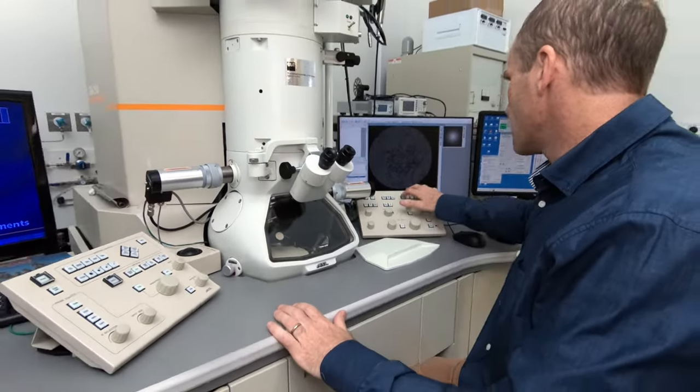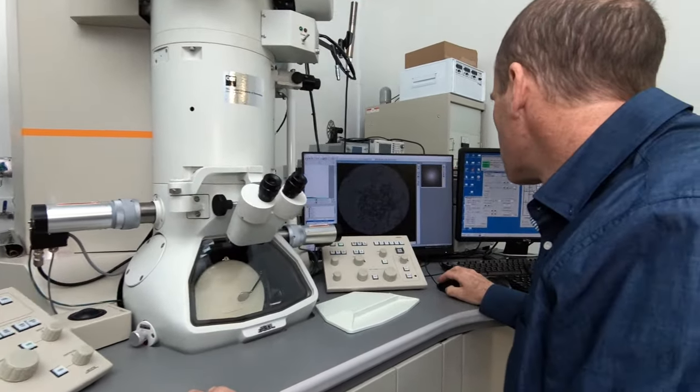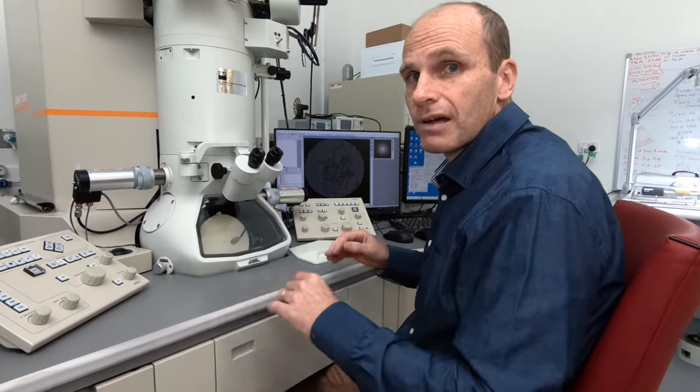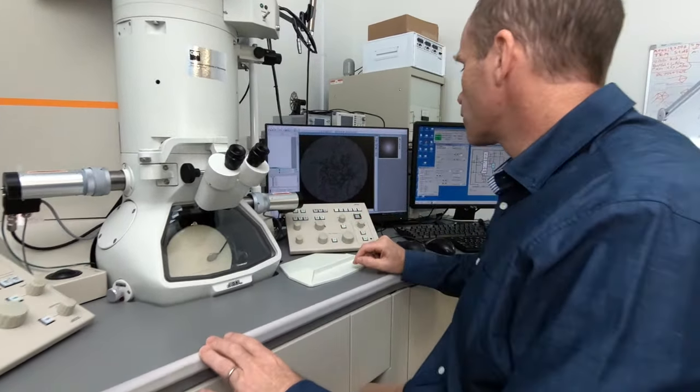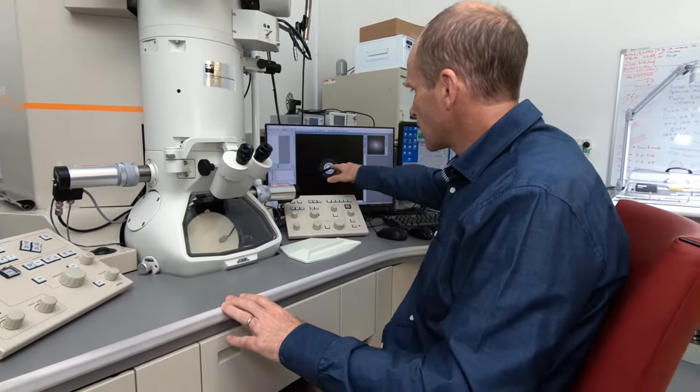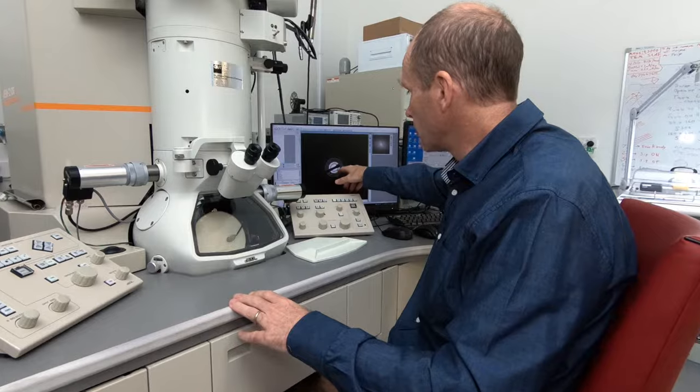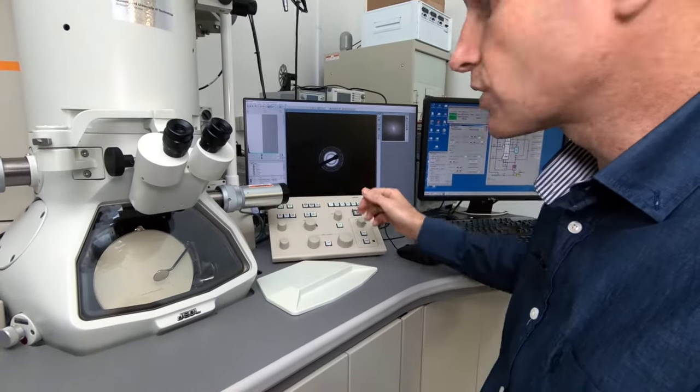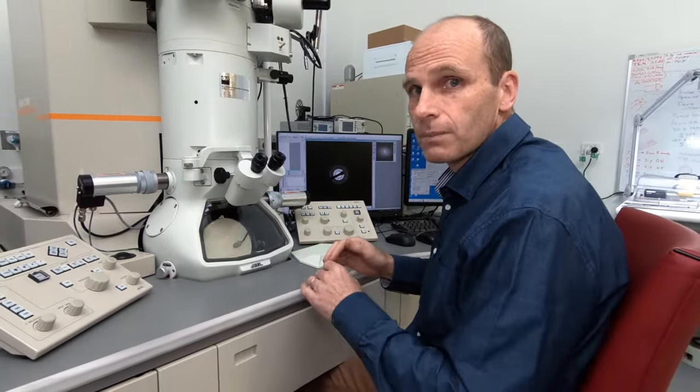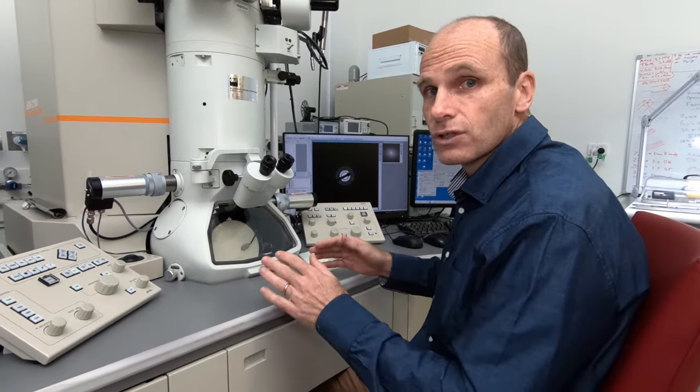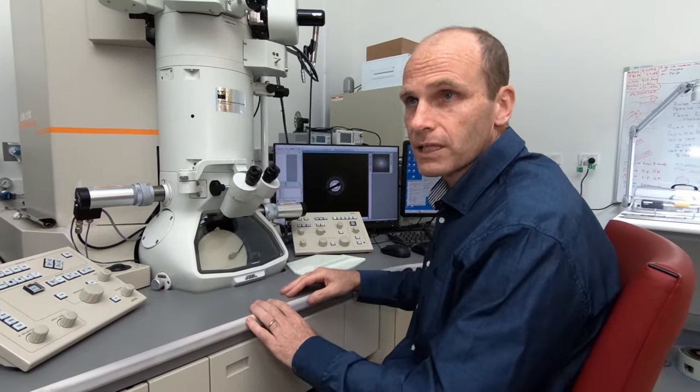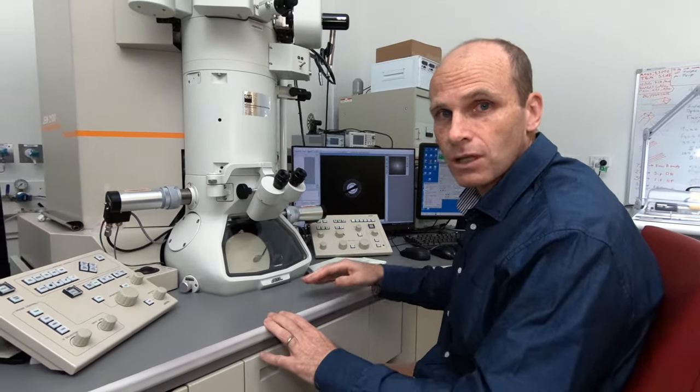And so now if we're going to go and take an image, we'll do that. And for the diffraction patterns, we often take a longer image because there's a large dynamic range that we need to capture. And over here on the screen, we should see that this image gets replaced by a diffraction pattern, which looks like this. So here you can see the central beam. These are for the electrons that have gone through and haven't been scattered by the sample. And then you've got a series of rings. The rings indicate to us that it's a polycrystalline sample. And the spacing of those rings indicates the spacing between the interatomic planes in the particles. And this is very characteristic of a certain crystal structure and a certain type of material. We could measure these and we could clearly identify that the sample that we're looking at is actually gold, as we expect. So it's a very powerful technique and one which a lot of people use in transmission electron microscopy.